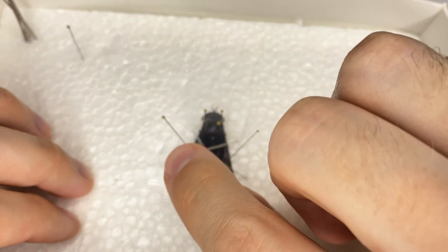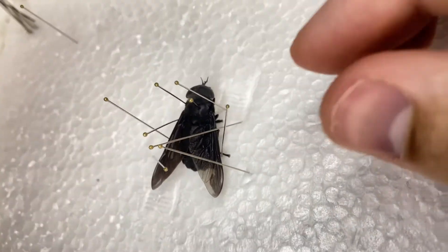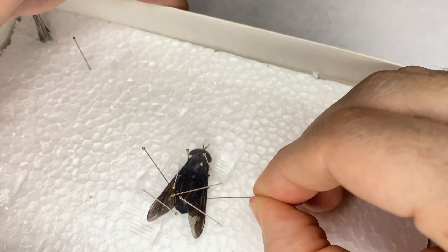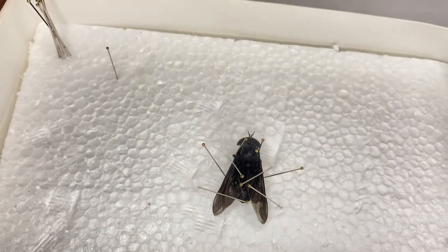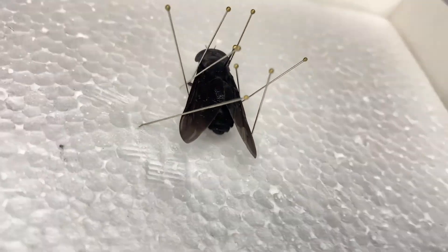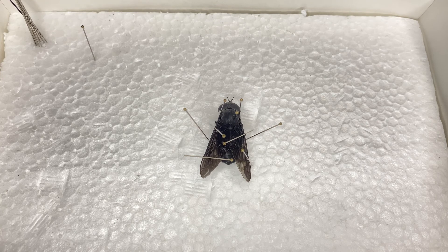You can use as many or as few brace pins as you want — some people don't use any. See, the legs are more or less underneath the body. Let's fix this little one a bit — you can see that foot sticking out. The claws like to grab onto the foam, so just adjust as needed. As it moves around, you can adjust the pins you've put in place and make sure your bug is looking nice with nothing sticking out too far. Now you just let it dry out for about a week, then pull out the brace pins and you're done. That is how you pin a horsefly.